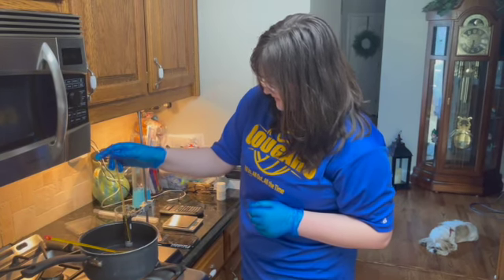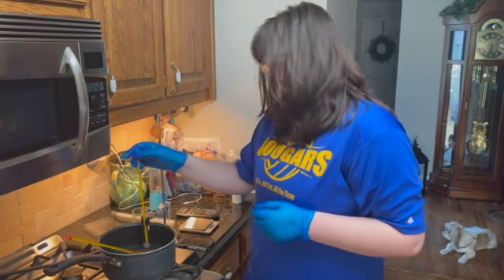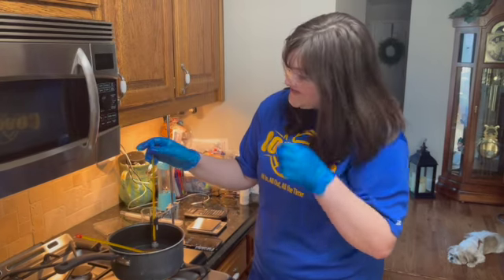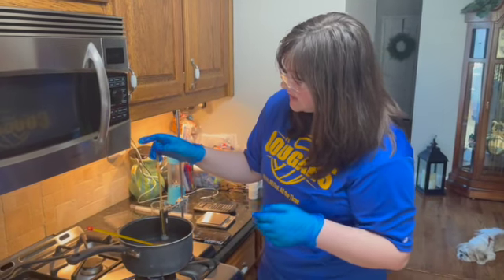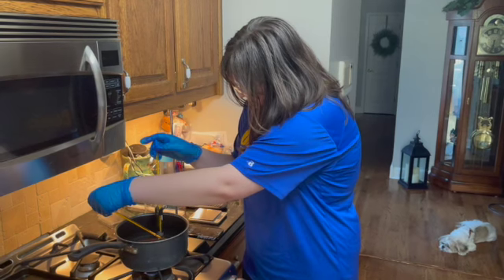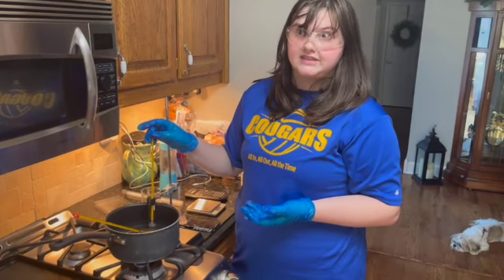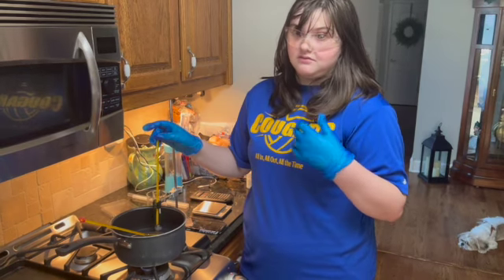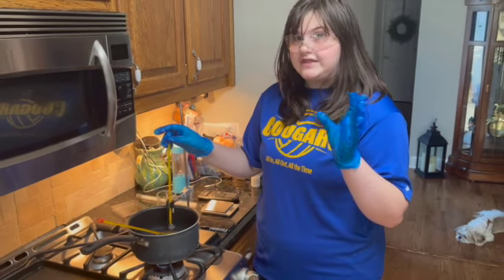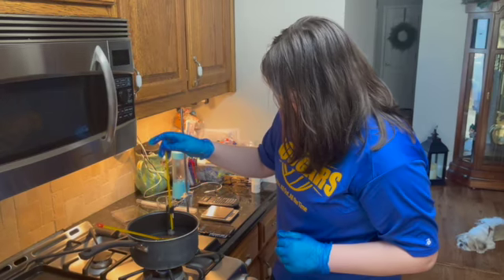So we are now at the 6-minute mark, and our solvent is at 49 degrees Celsius. So it's getting a lot closer to this solvent's melting point, but our hot bath is at 54 degrees Celsius. As we can see, the temperature of our solvent is getting a lot closer to its melting point, which in doing research for this lab is said to be roughly the range of its melting/freezing point. Okay, we are getting close to our 7-minute mark here.